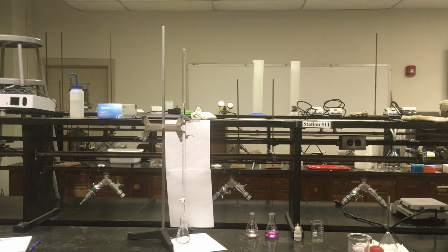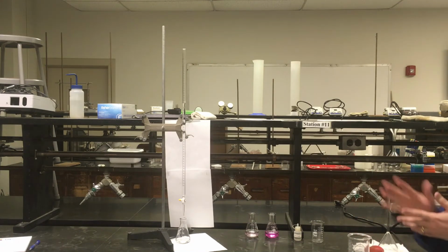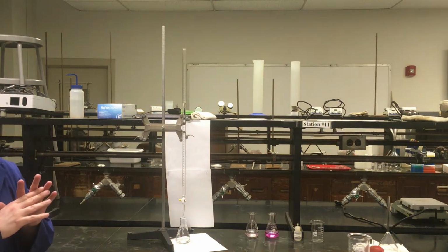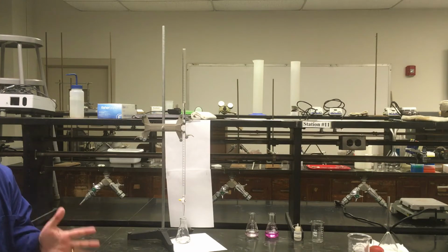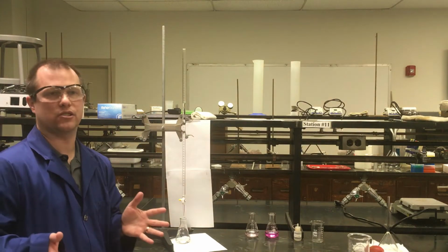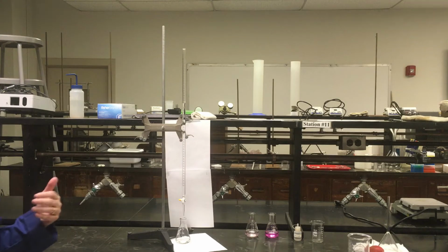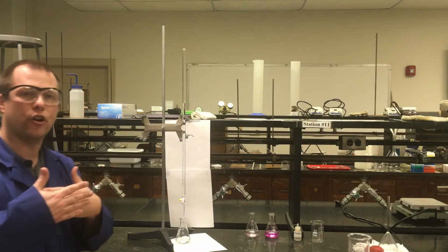So at this point, I should have everything pretty much ready to go. I've added my phenolphthalein. I have the acid measured out. I have my base all in my burette ready to add. So at this point, I can go ahead and start adding my base. If you haven't done any trials yet, if it's your first trial, if you want your first trial to be accurate, you want to add really slowly because you have no idea how much it's going to take to do this neutralization. And so by adding slowly, you're safeguarding that the reaction doesn't finish and you're not ready yet, basically. Like I said, I have a little bit of foreknowledge. I know about what volume I need to add.